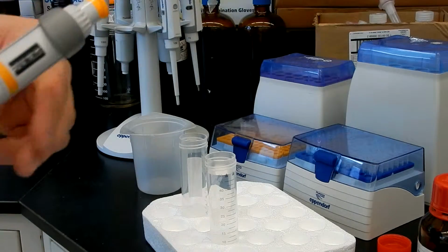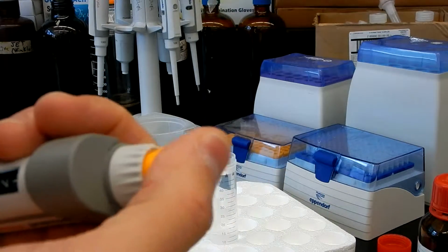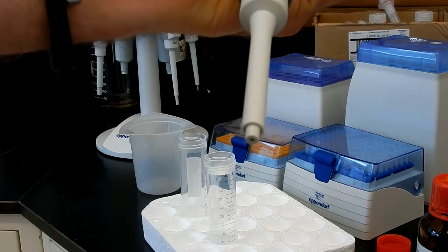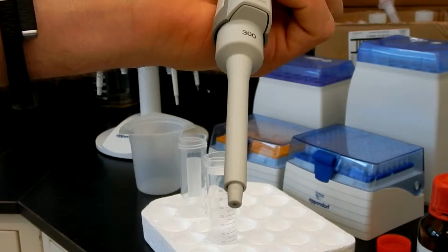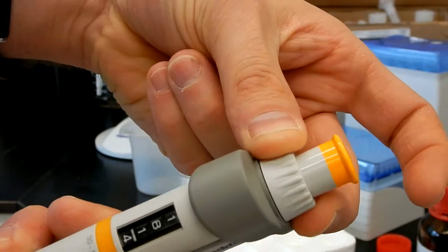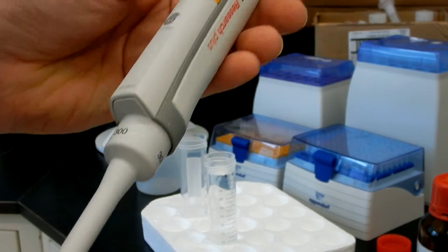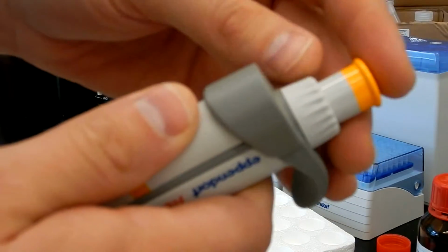Okay. All the pipettes are built the same way. So you have your piston here, and you have this button which, when you press on it, moves this part, so it will allow you to eject the tip without touching it. This is a knob for adjusting the piston to sip the liquid in, and when you push on it, it will expel the liquid.